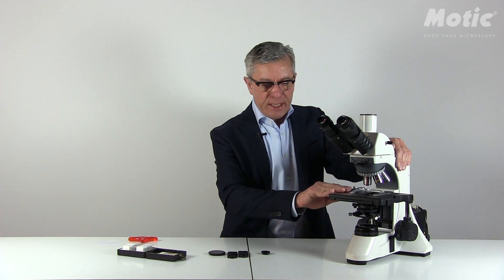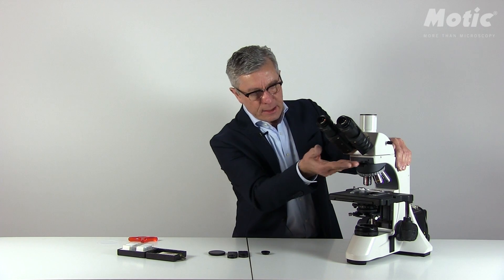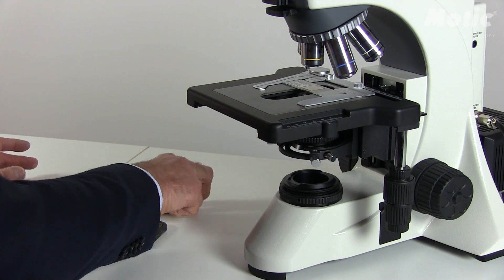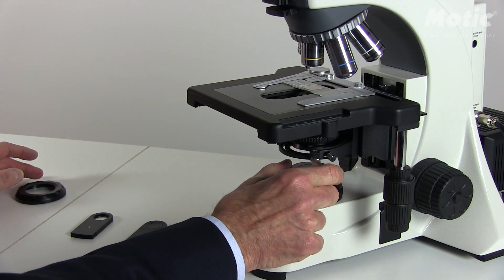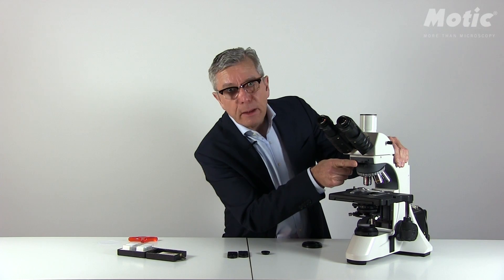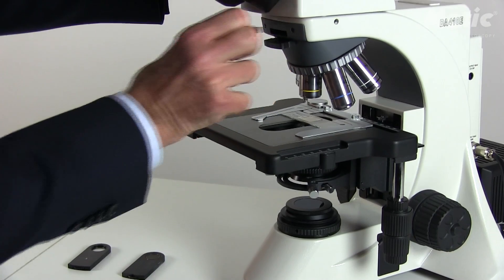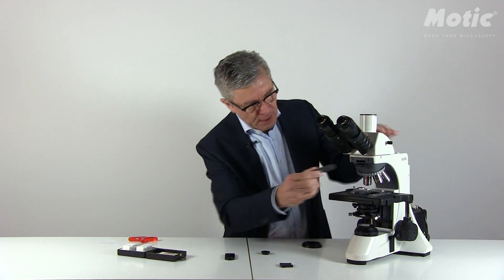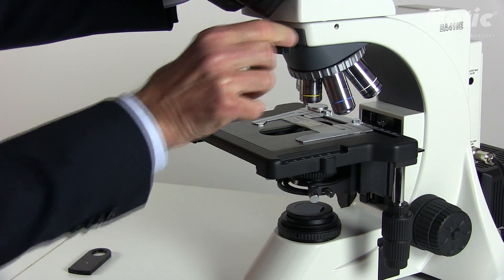In all BA410 models the situation is exactly the same — you have to place your sample between polarizer and analyzer. Regarding the polarizer, the situation is very similar to BA210 and BA310. Remove the protection ring and place the polarizer on top of the light exit. Note that we have two slots in the upper part of the microscope; the upper one is for taking the analyzer. Push in the analyzer to the end.